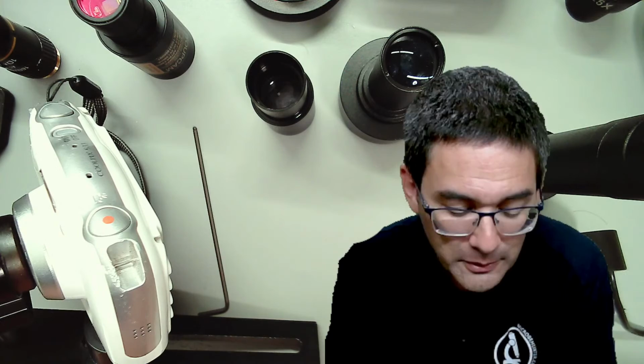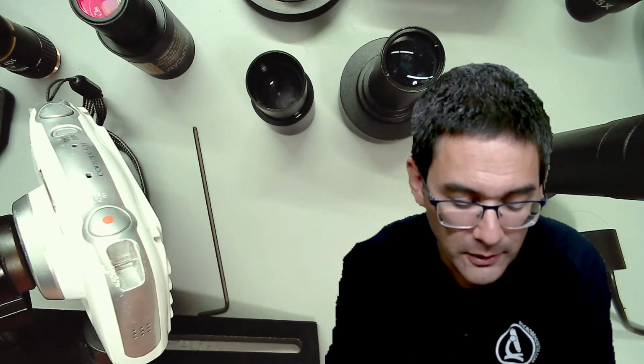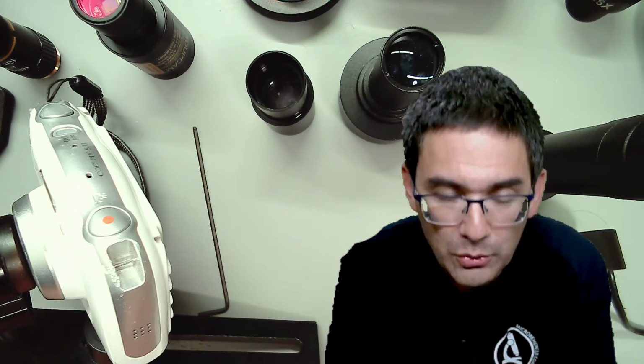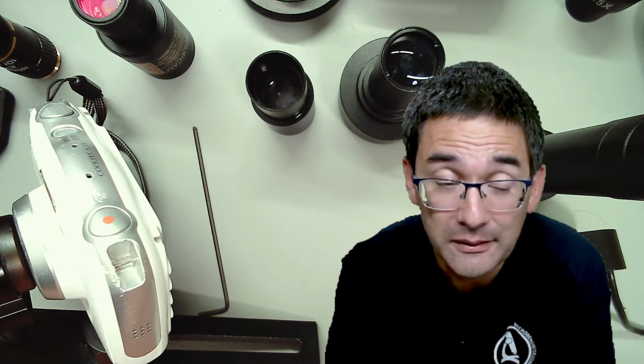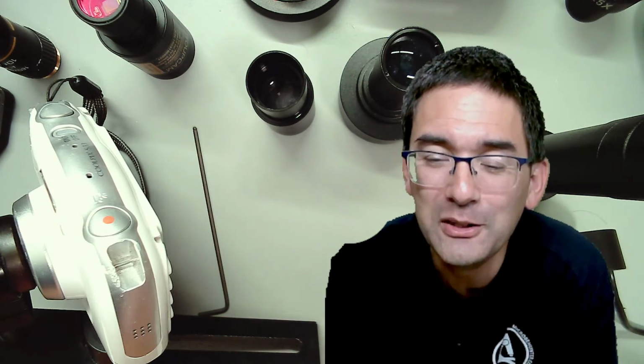I know that many of you probably don't have all of the equipment that I talked about here, but I simply just wanted to give you an overview of what I've got here, simply to help you classify a little bit what ways there are to get a picture from a microscope into the camera.